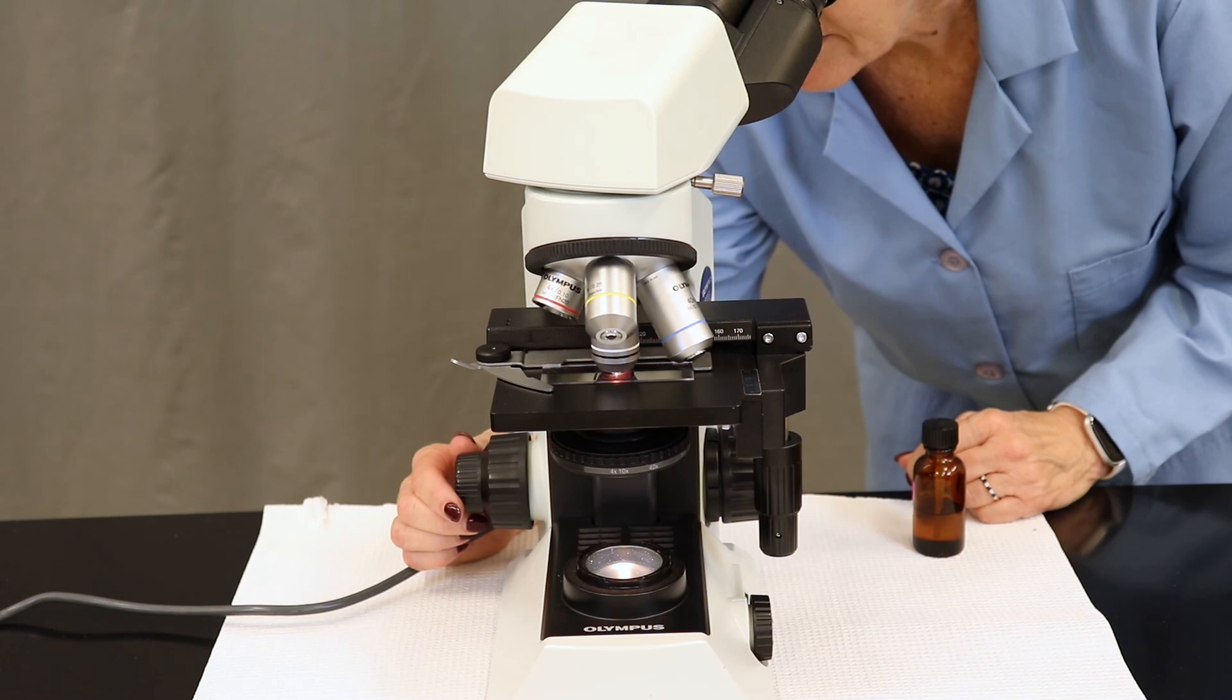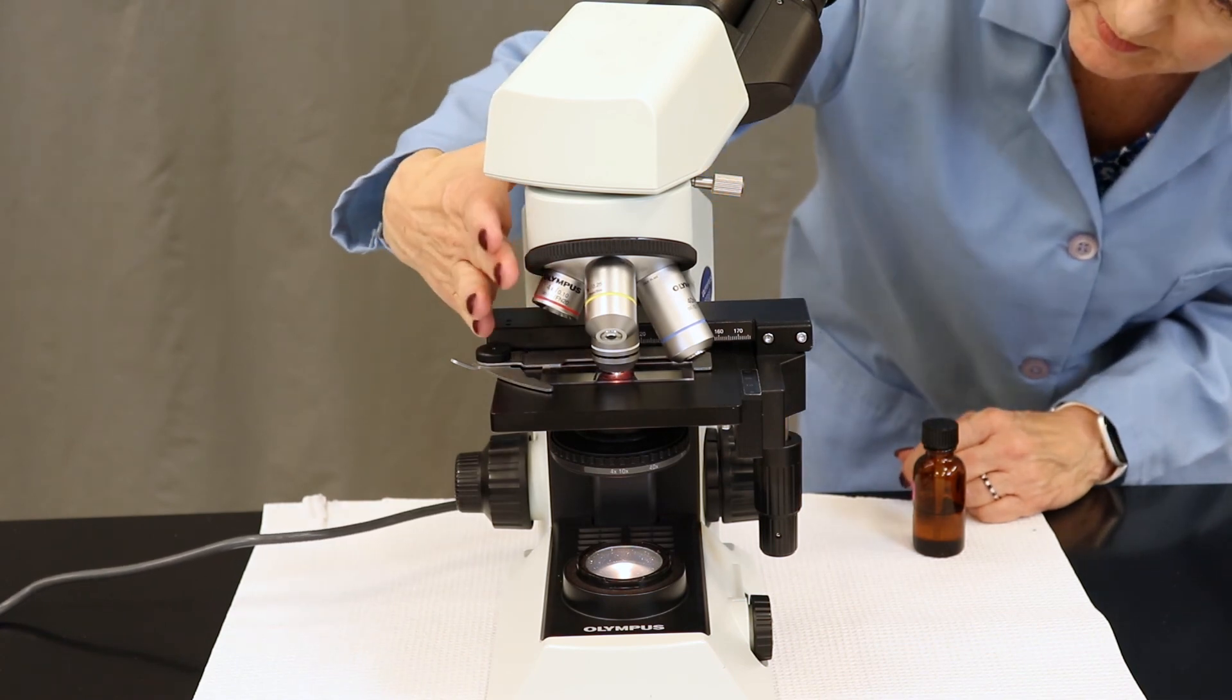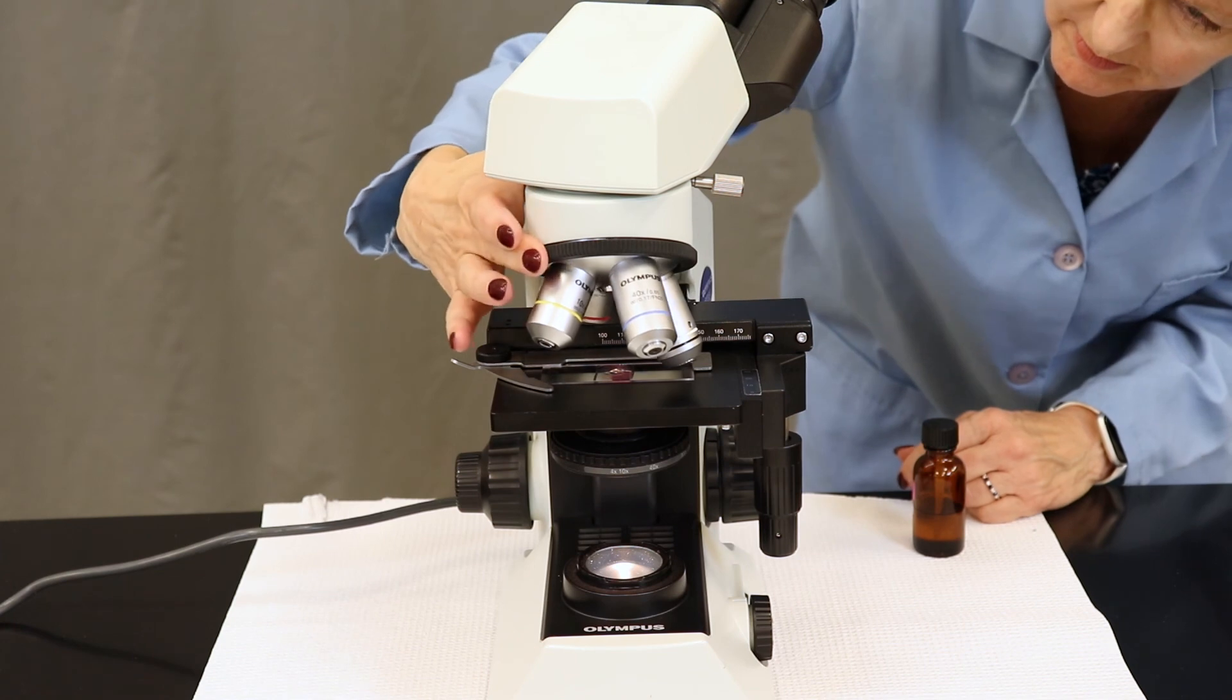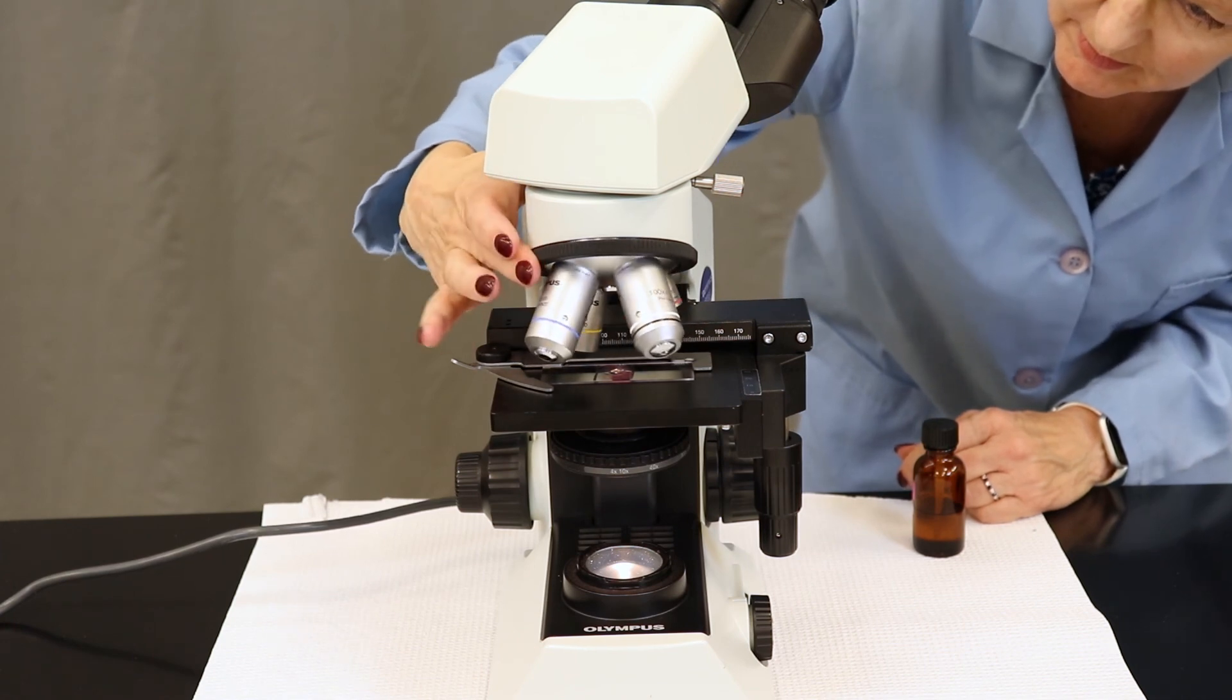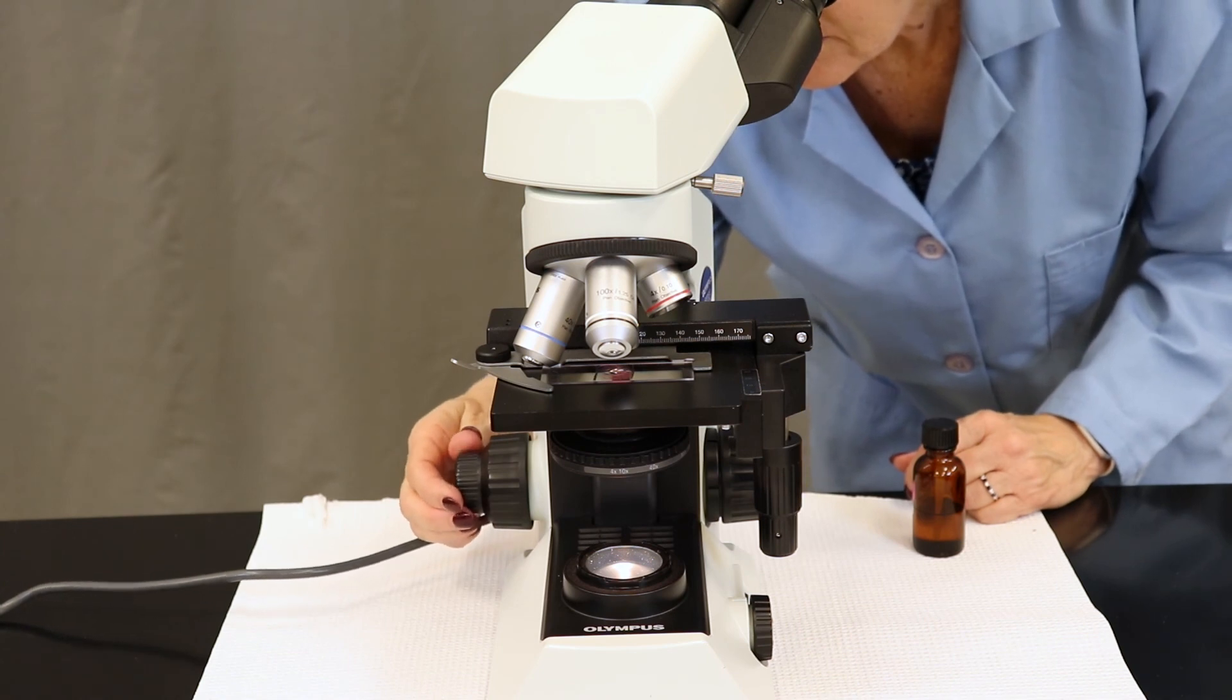If you're stuck and you're not able to identify any bacteria at 100x, you cannot simply go back down to 40. It's really important that you only get oil on the 100x objective. However, you are welcome to go back down to 10x or 4x and scan through your slide again.